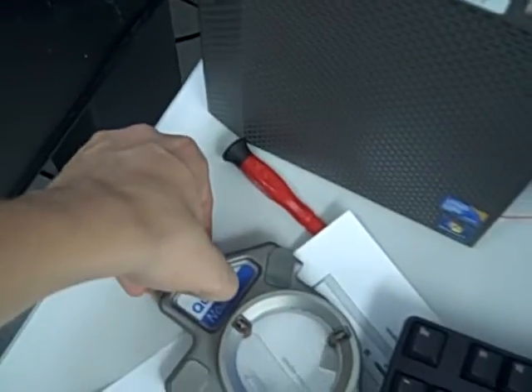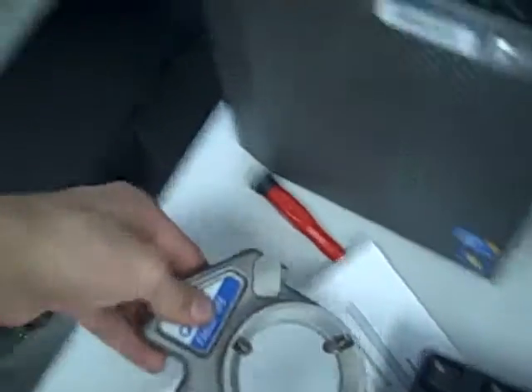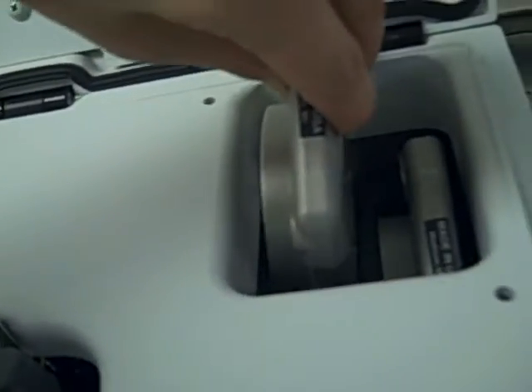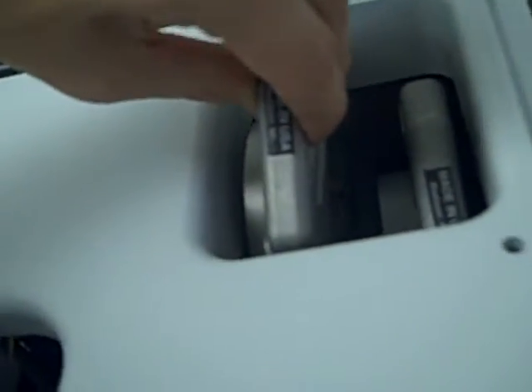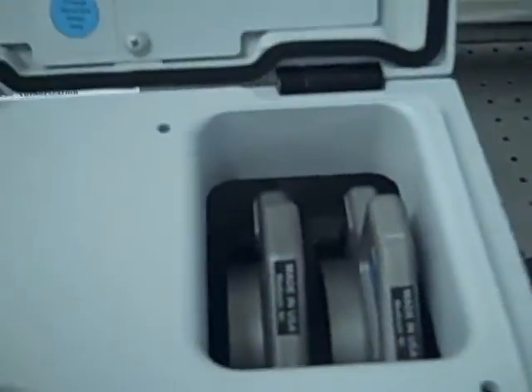Then you grab your old beam splitter and put it in here. Make sure you don't touch the middle of it because you are going to ruin it like that. You drop it right into place like that, you close this, and lock it.